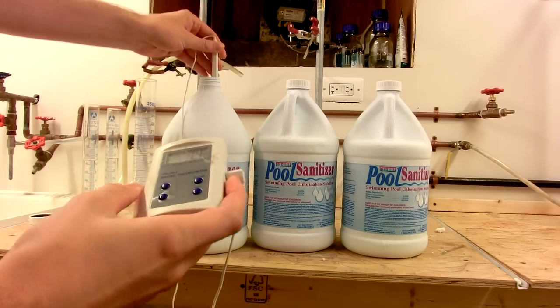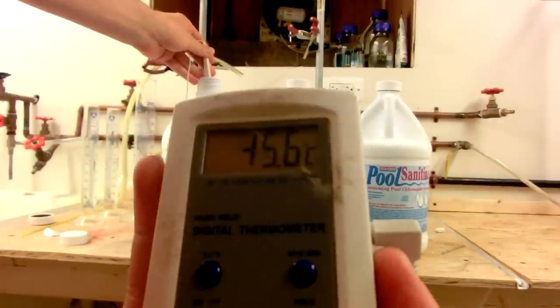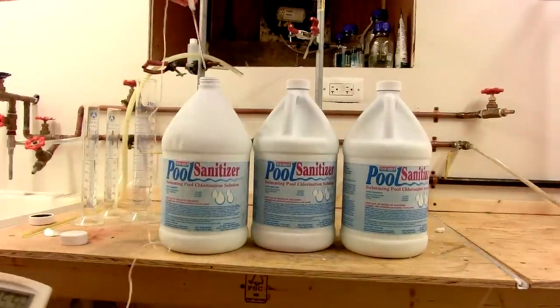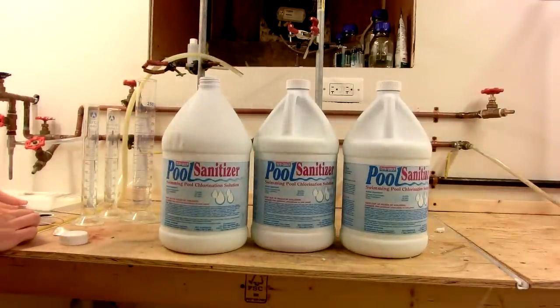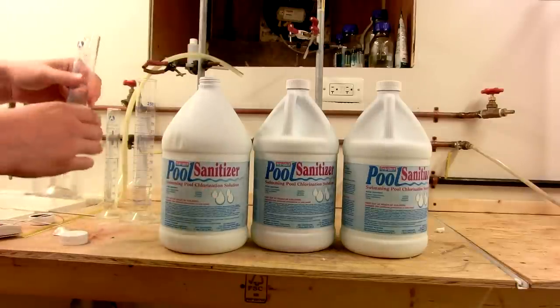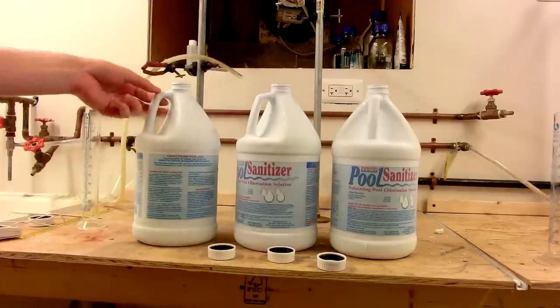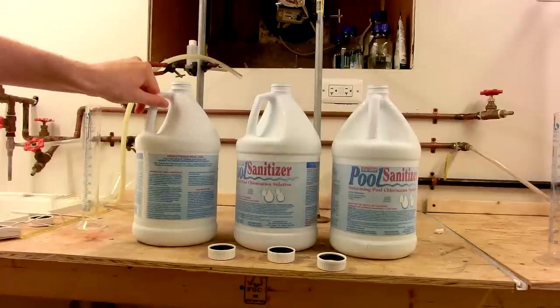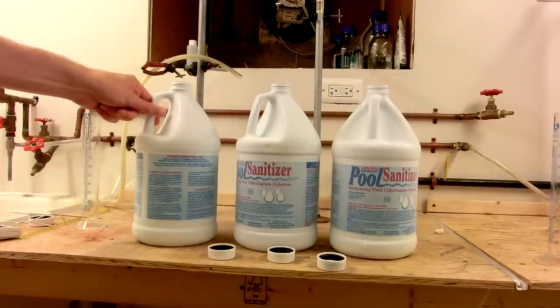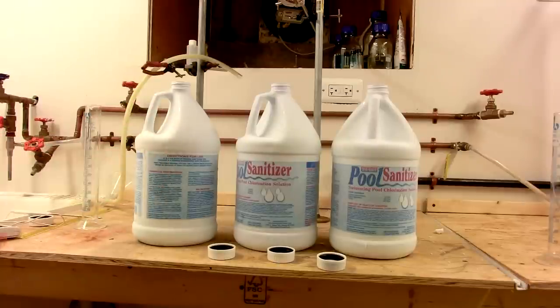Using this thermometer probe, you can see that this gallon of 10% sodium hypochlorite, though it's still liquid, is at about minus 16 Celsius. I'm now going to add the first 65 milliliter portion of acetone, close and shake, and we'll re-measure the temperature to see how high it becomes. A one-half portion of acetone has now been added to all three one-gallon jugs. The reaction will not proceed at an appreciable rate until these jugs warm up a little bit, so we'll leave them out for about 20 minutes, then stick them back in the freezer in preparation for the second addition of acetone.